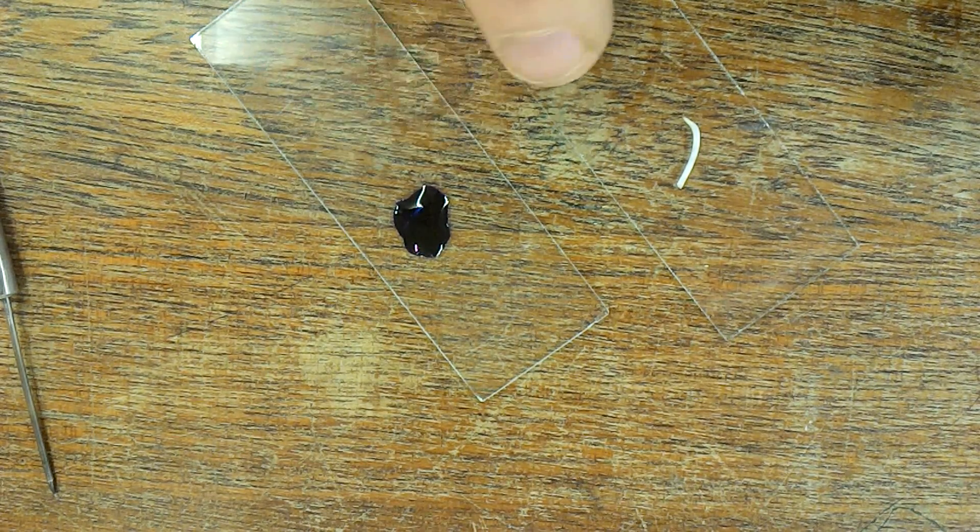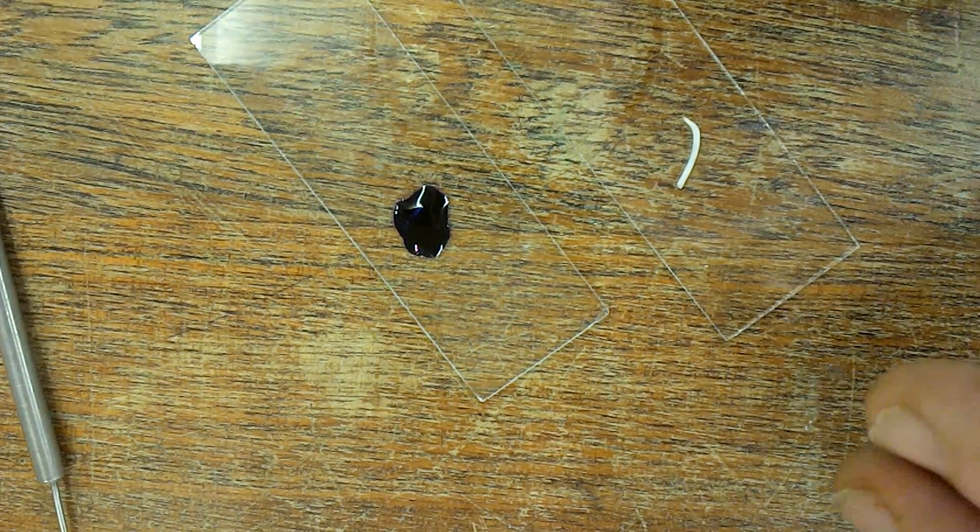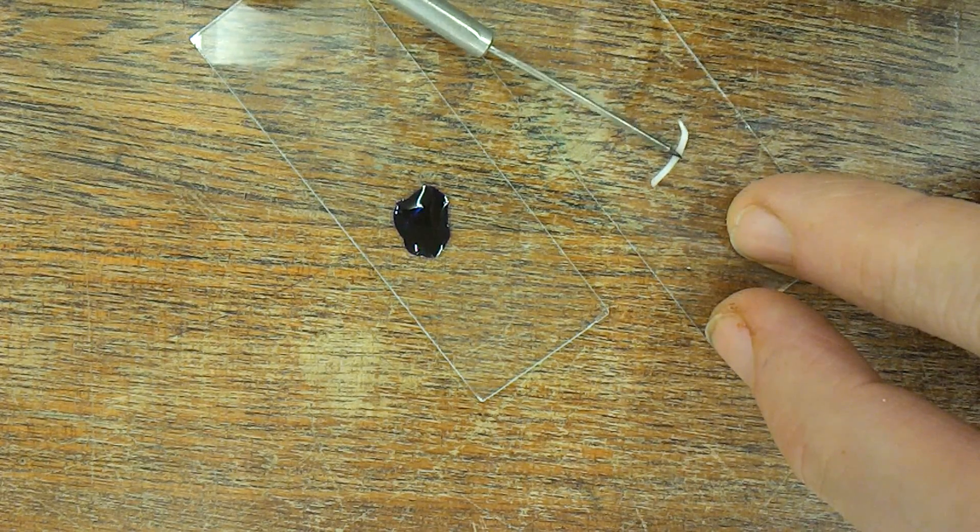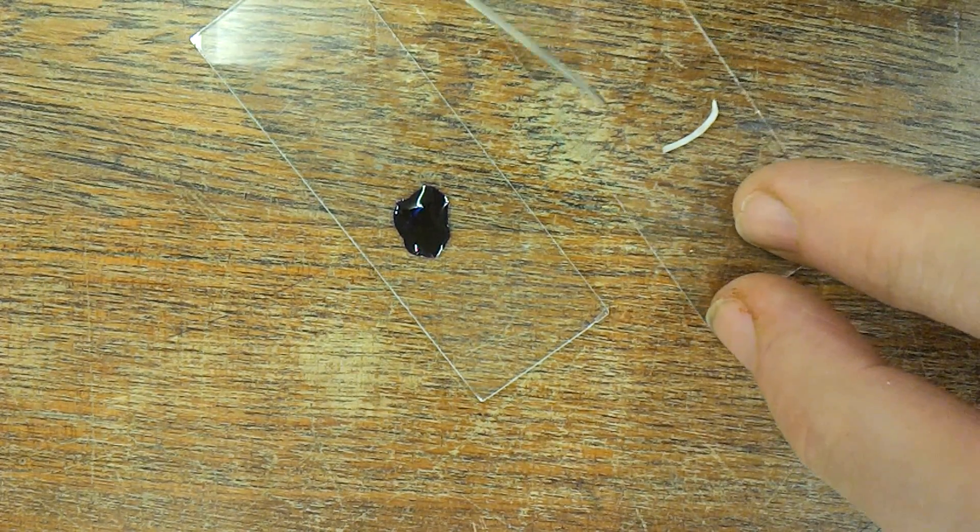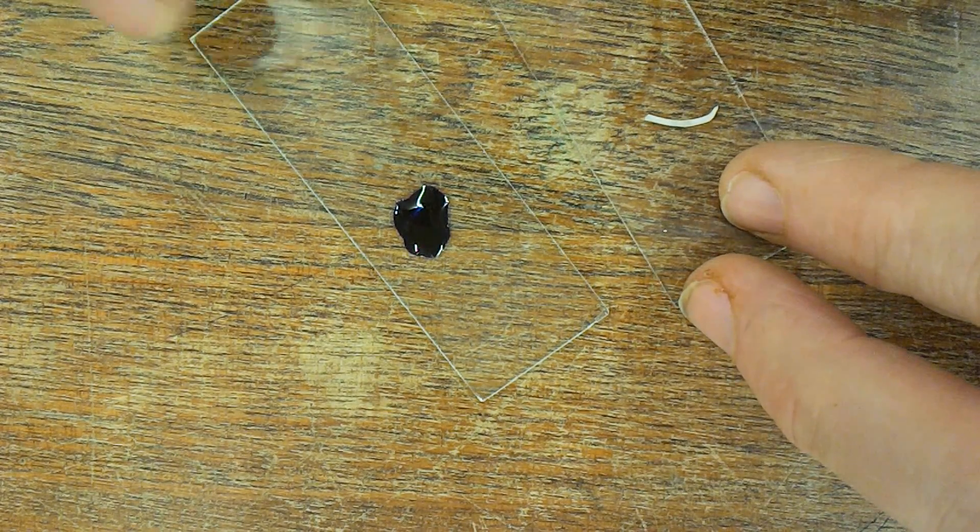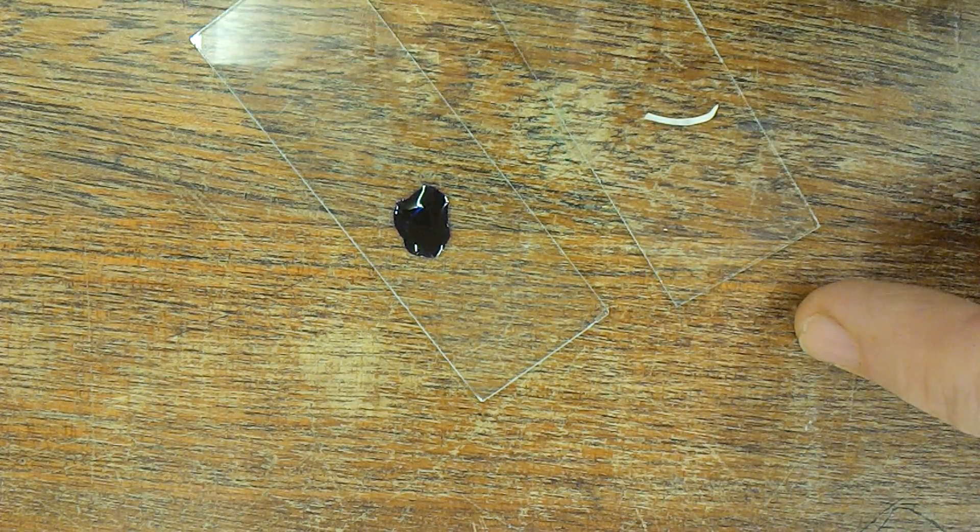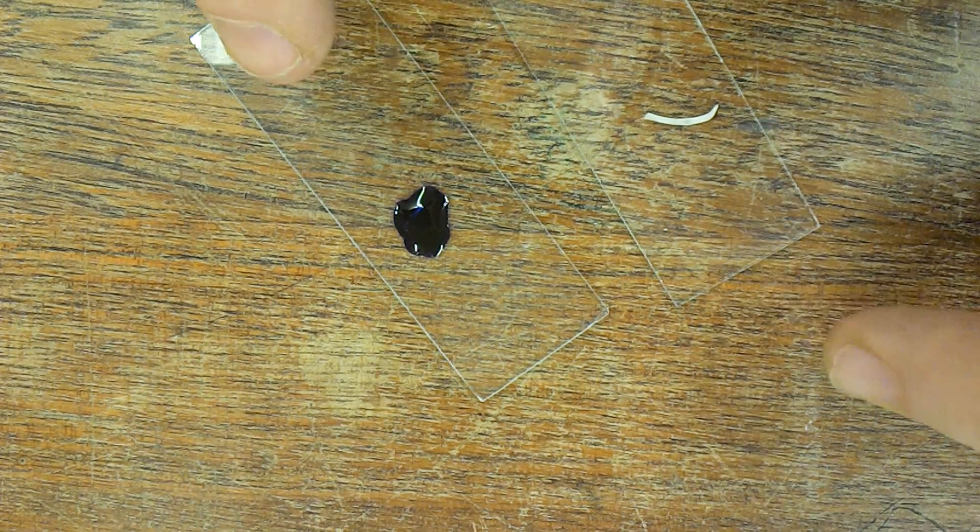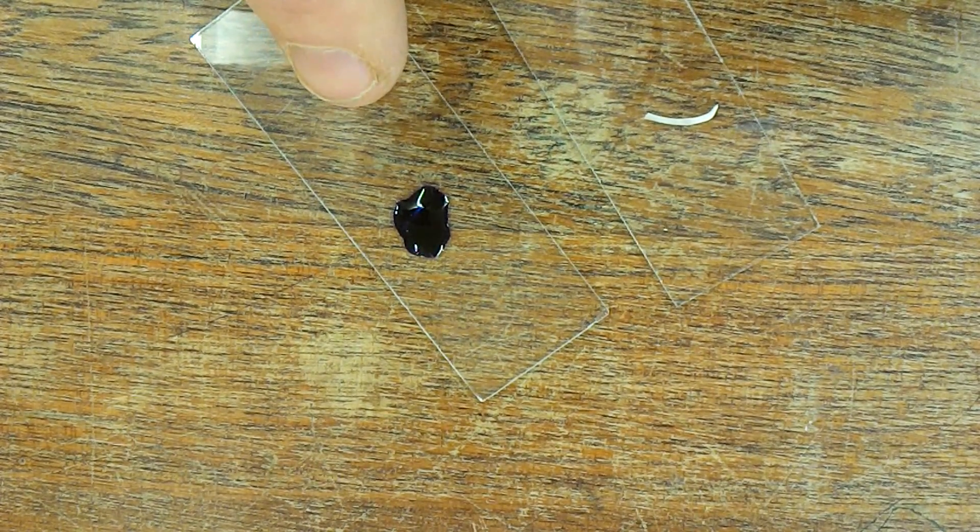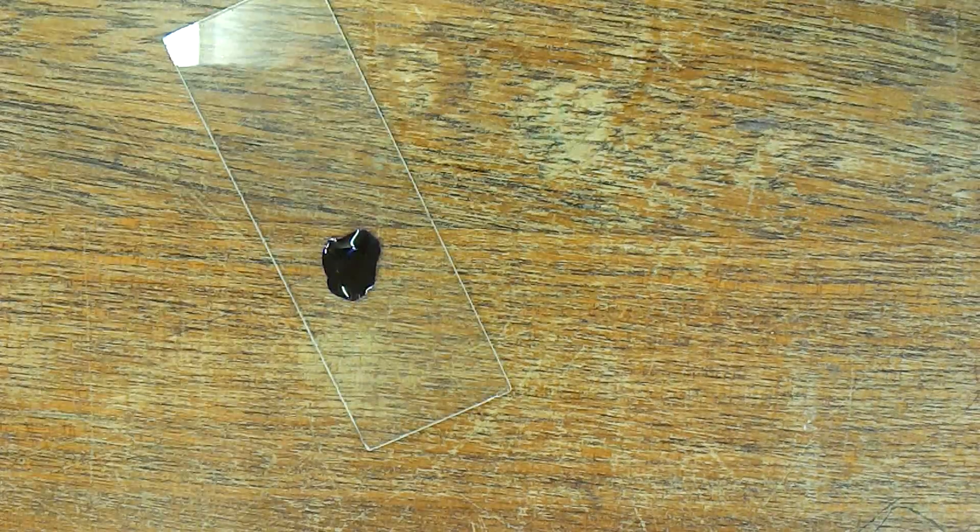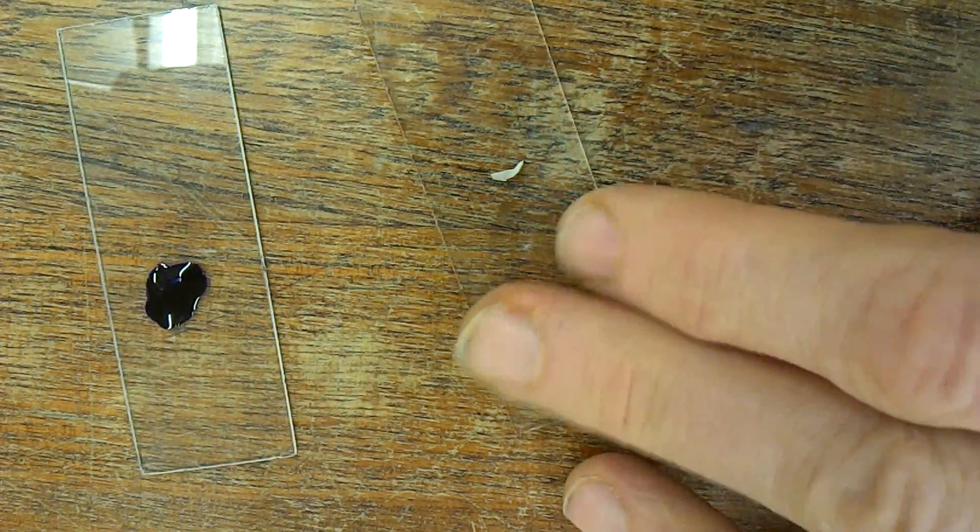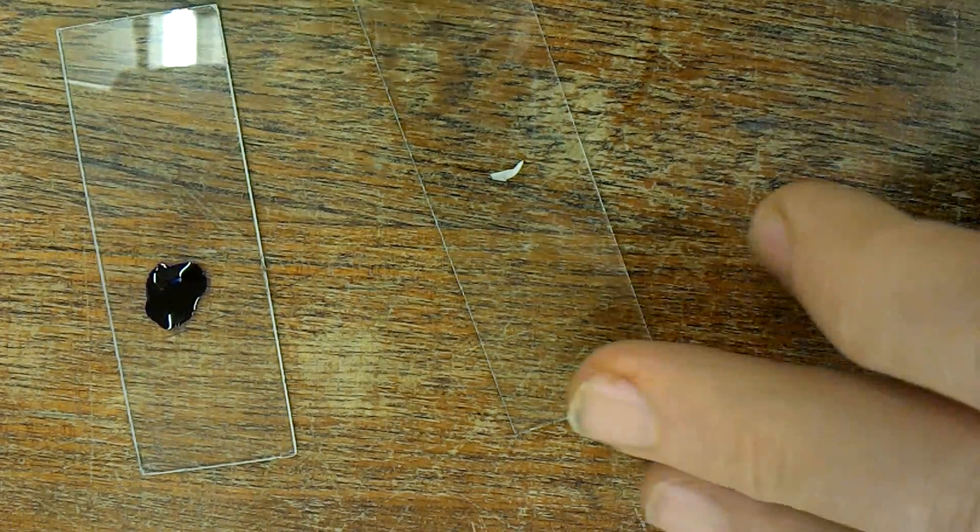Two minutes afterwards, we're going to stain this one, then this one, etc. You will end up with four slides, each stained for different periods of time. Two minutes later, you can stain the second one.